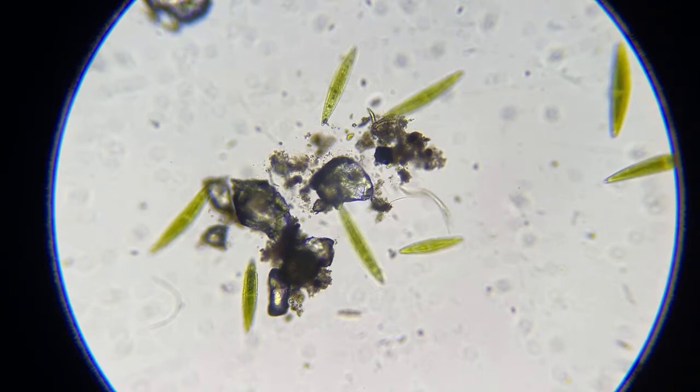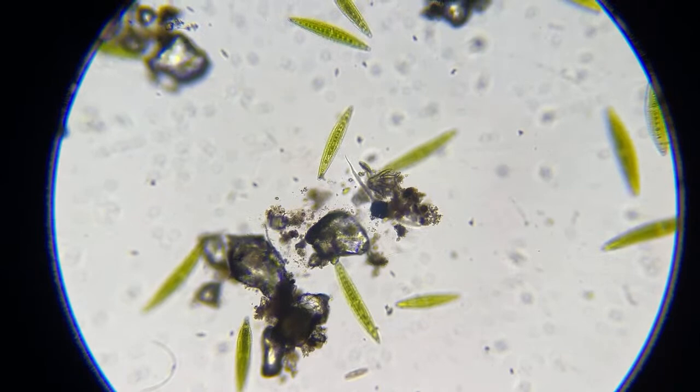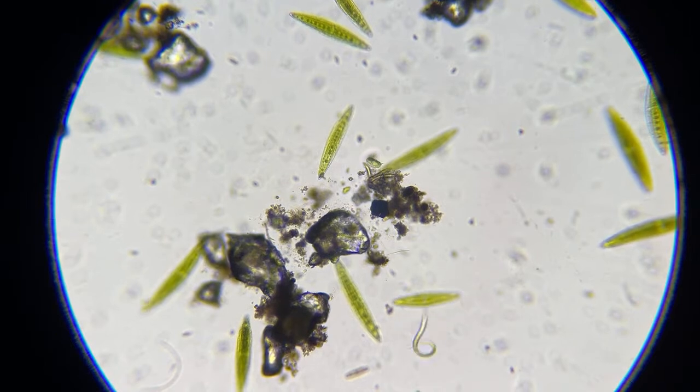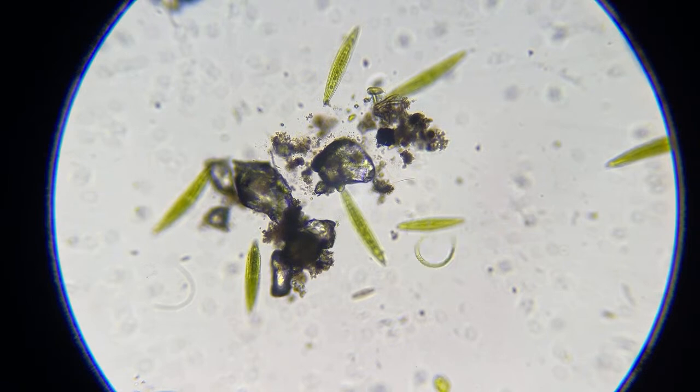And that's what they do. They wiggle around like that, and they lay eggs, usually in your intestine or an animal's intestine. Then they'll hatch. The animal will poop out the eggs, and then a dog will come around and step on them, and the cycle continues. So that's what that is, a hookworm.